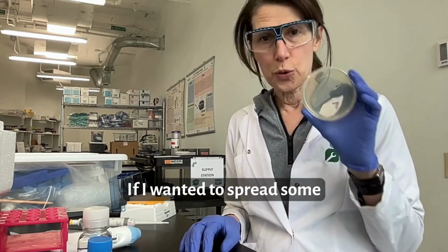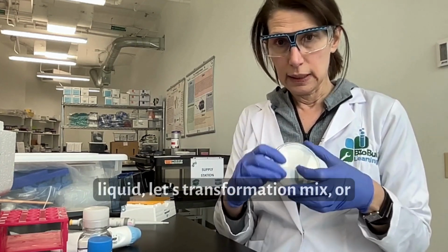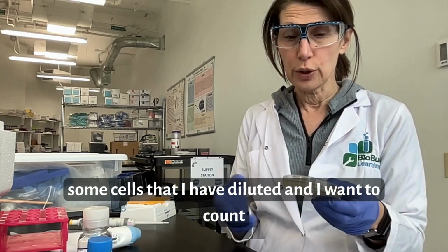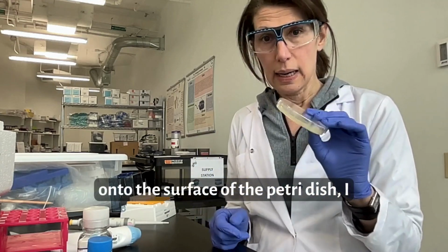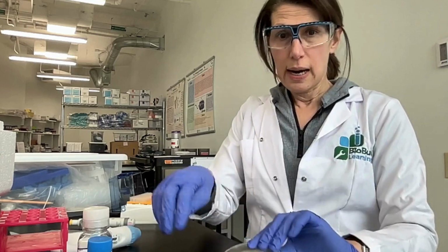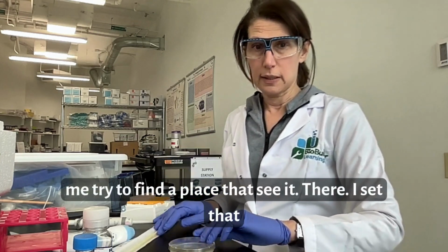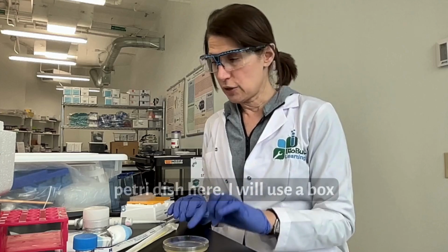If I wanted to spread some liquid, let's say transformation mix, or some cells that I have diluted and I want to count, onto the surface of the Petri dish, I will set that Petri dish here. Let me try to find a place that you can see it. There. I'll set that Petri dish here.